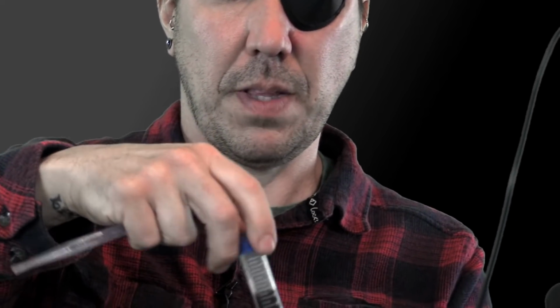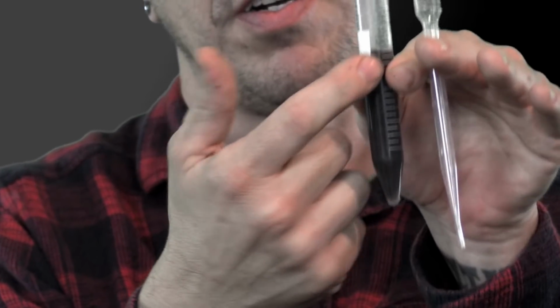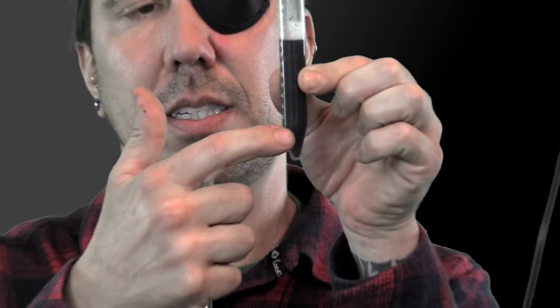One other thing, when you're using your pipette to grab something out of this, a lot of people ask this question. One thing I neglected to say: you've got 9 parts water, 1 part solid. When you're mixing that up, to do it in a scientific manner, you want to do it the same way every time. The way that people in the soil food web classes do it is to count to 30 and do a quarter of a circle turn, and do that 30 times. I'm not going to do the whole 30 times on camera here. And then I generally wait a few seconds after shaking it up just to let things settle a little bit.